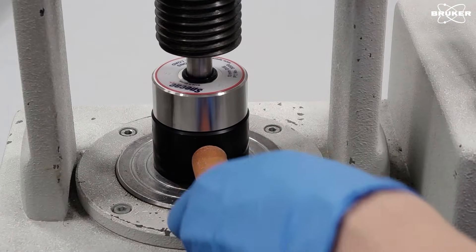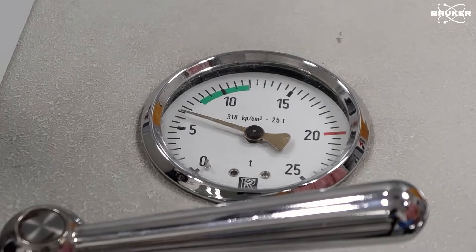Keep the pressure at 10 metric tons for 1 minute after applying the vacuum.